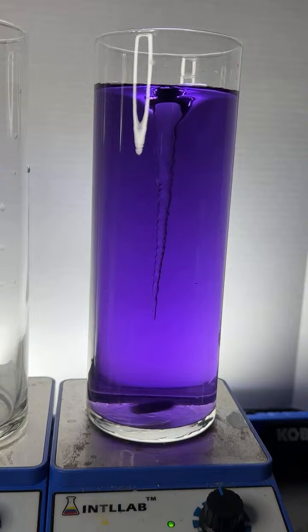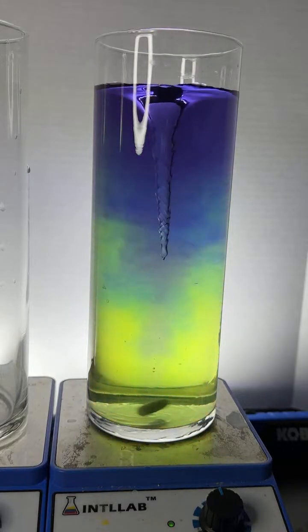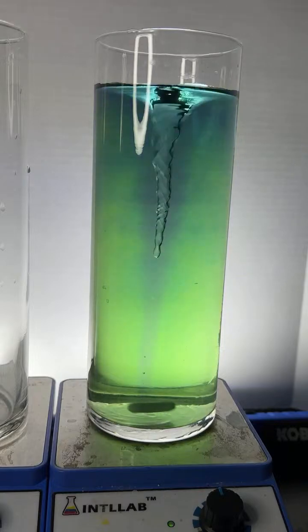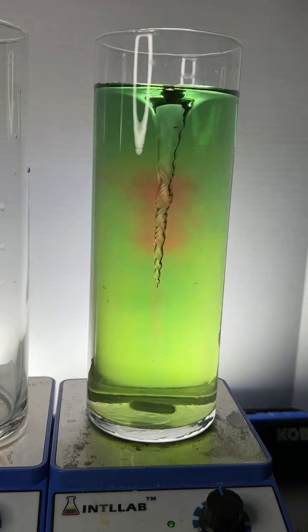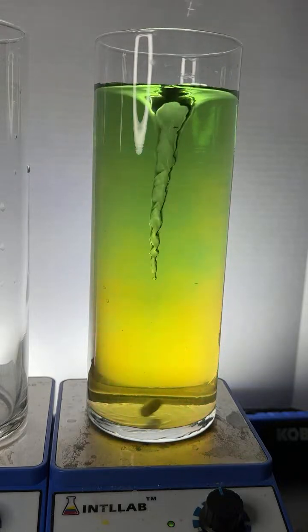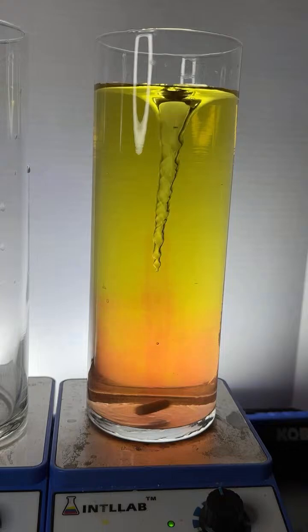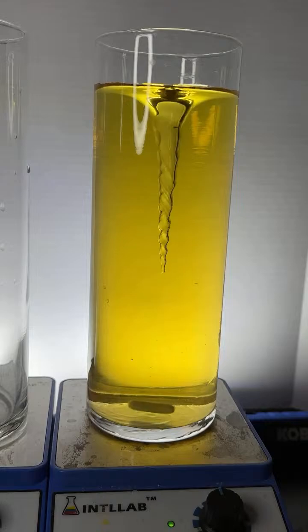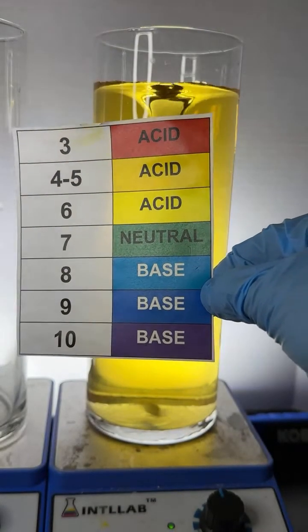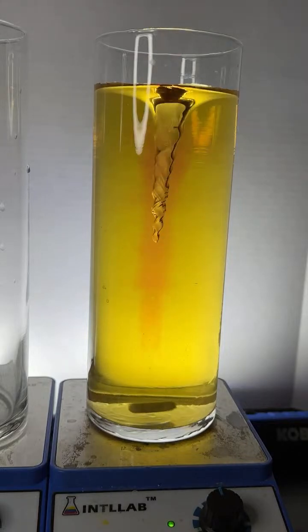All right, I'm going to start adding acid now. I'm going to add drops of acid up here at the top. In goes one drop. It's beautiful. In goes the second drop. Whoop, there it goes. In goes a third drop. In goes a fourth drop. That was kind of like a half drop, so I'll add two. That's like a pH of 6, maybe a pH of 5. We'll keep going. That's 6 drops of acid.